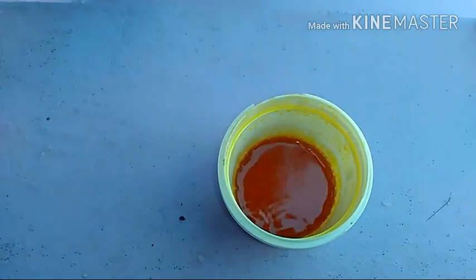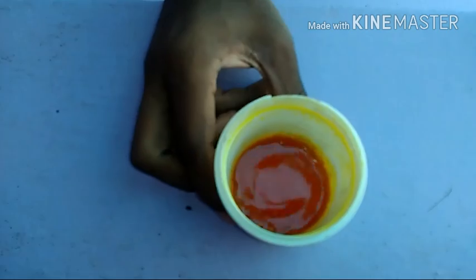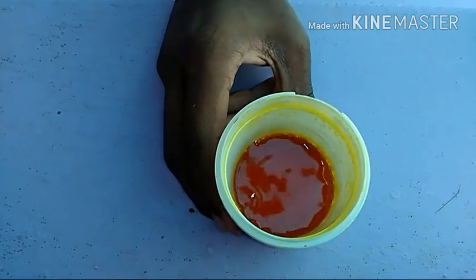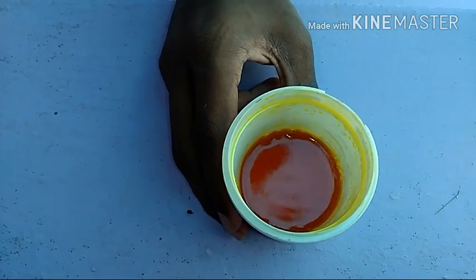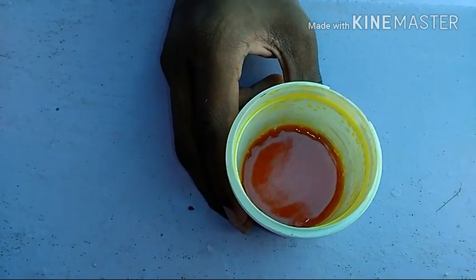Ferric chloride, FeCl3, is a colorful salt. It is brown in color. These salts are used by higher secondary school students for salt analysis. In industry, these salts are used for the treatment and purifying of water and the softening of hard water.